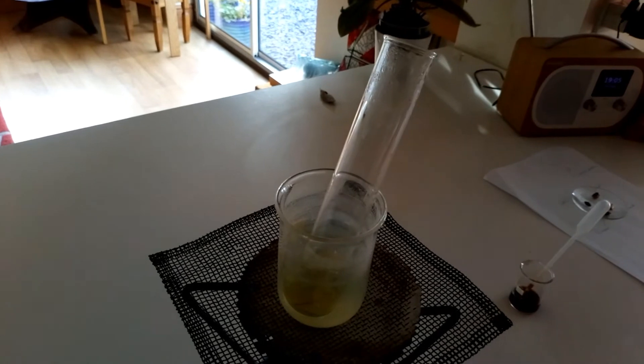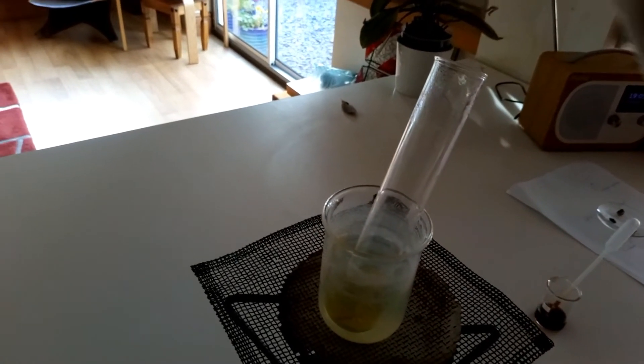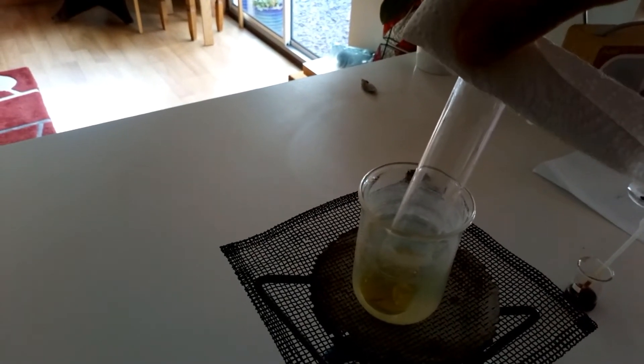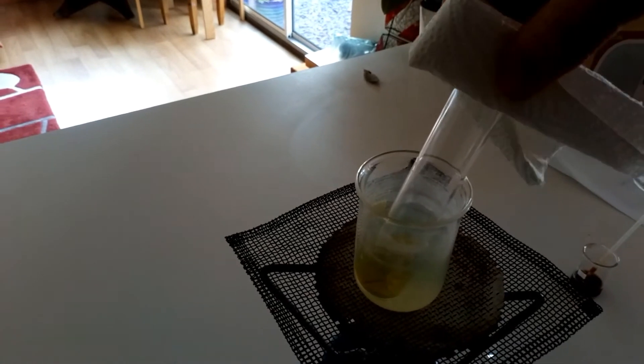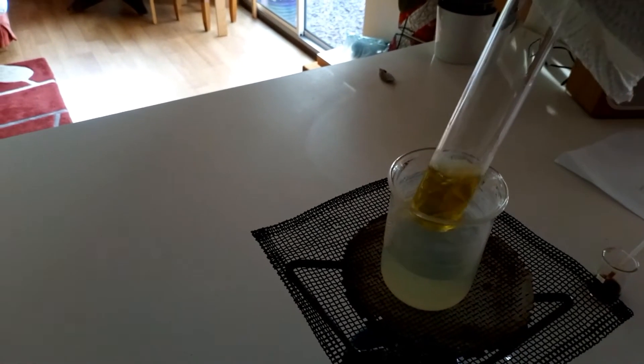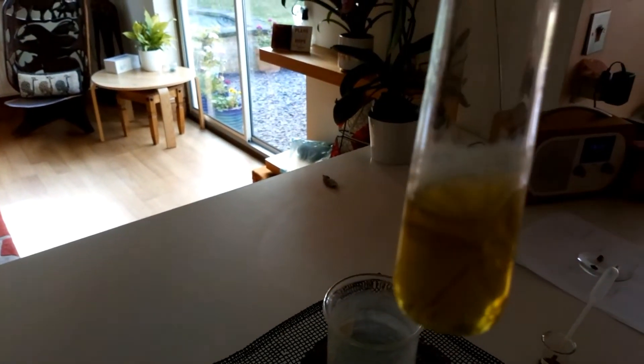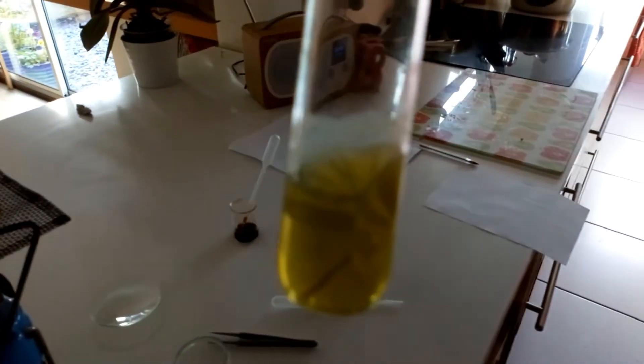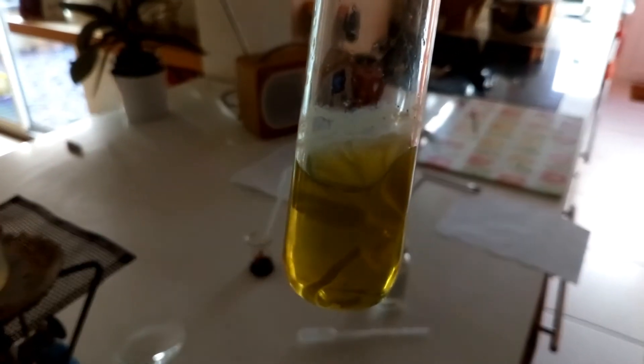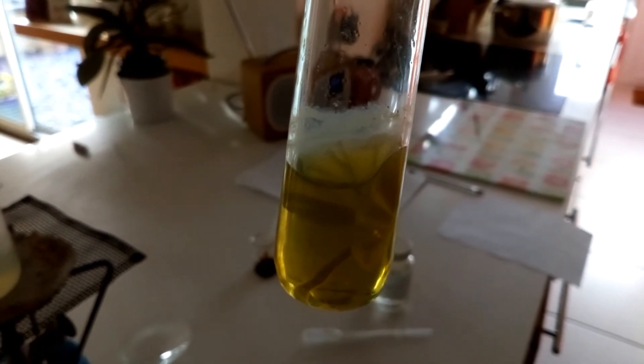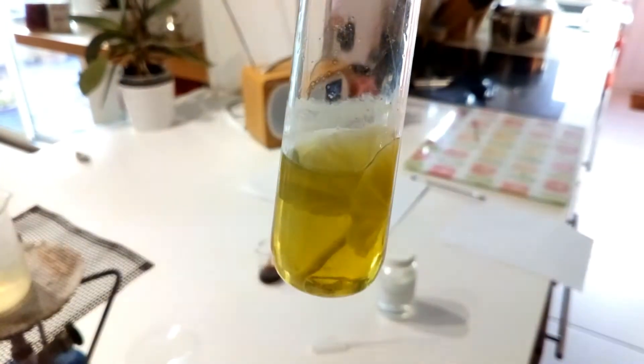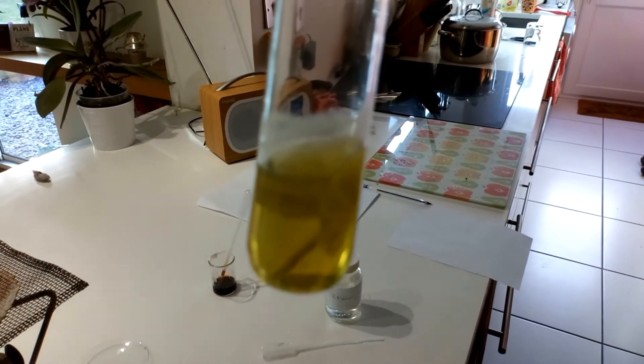So this has been boiling in here for about five minutes. So let's get a test tube holder and lift that up. You can see it's still boiling in there. You should be able to see that the leaf has gone quite white, and the alcohol has gone yellow. So what I shall do now is I shall get rid of the alcohol and then remove the leaf.